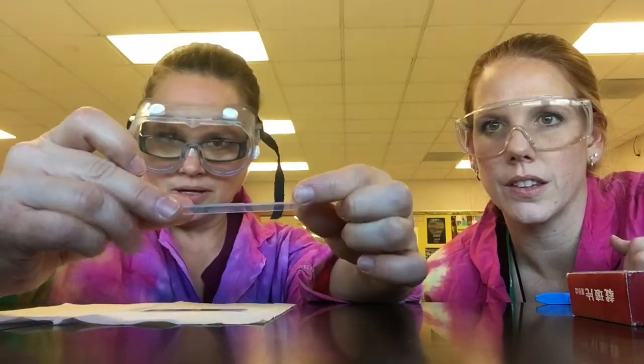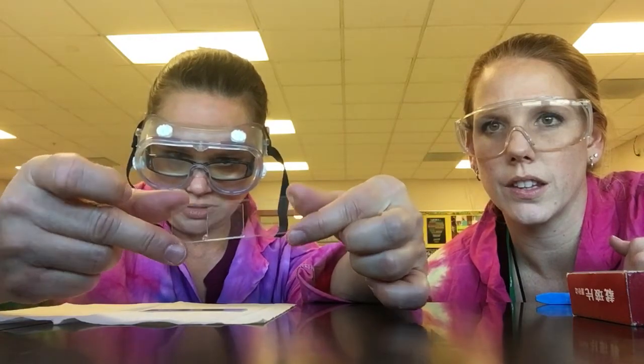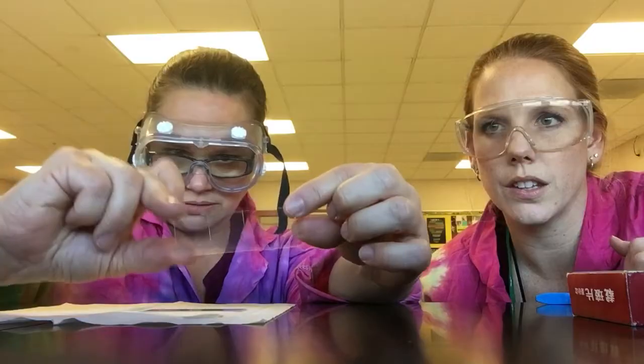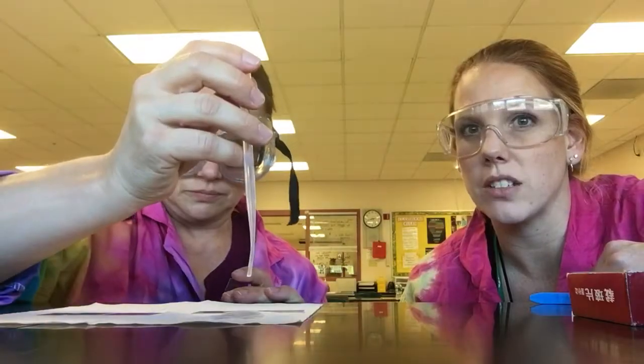When you contact the drop of water, open your fingers to release the cover slip. You want to carry the slides very carefully and hold them level when you carry them. We will have you prepare the slides at a wet mount slide-making station and bring them to your microscopes. Notice what we're wearing — because we're using liquids and possibly live specimens, we need to protect our eyes.